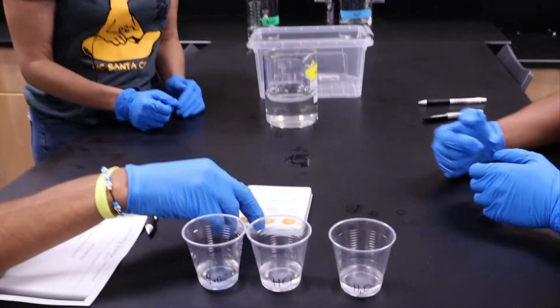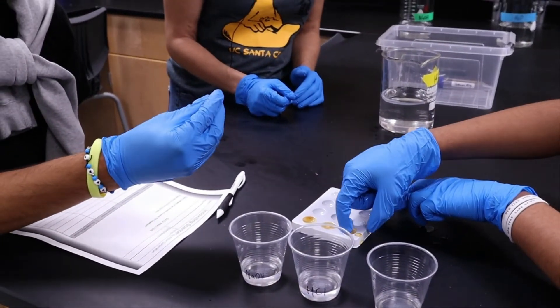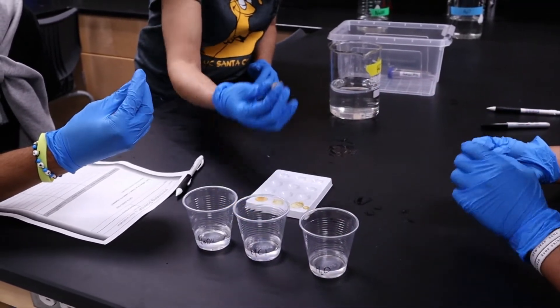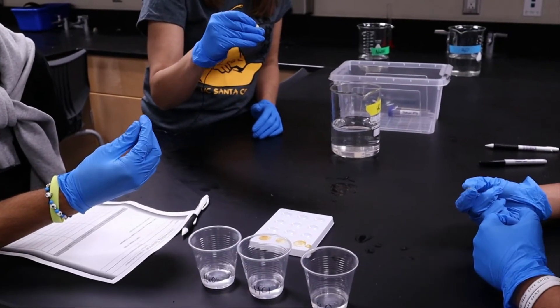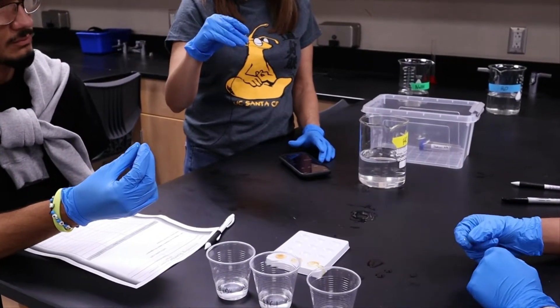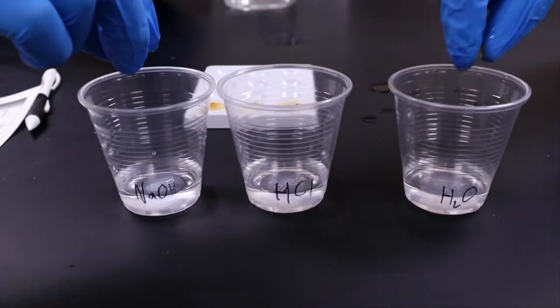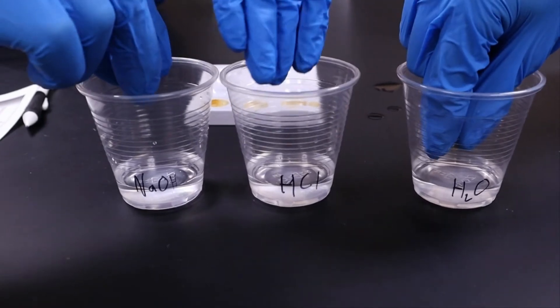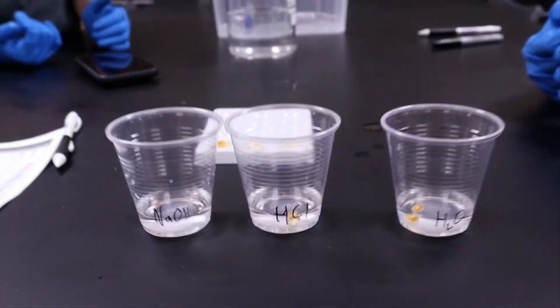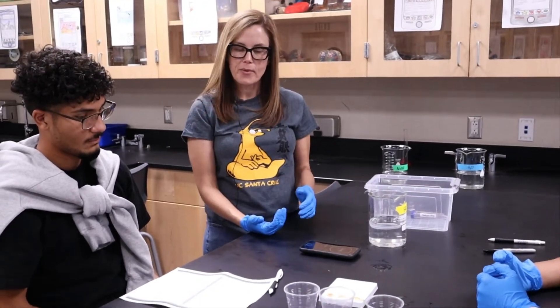Scoop out and then roll. Just roll it around in between your thumb and your finger — try to get it as coated as much as possible. I'm going to go ahead and set my timer for five minutes, and then we're going to put them in, one in each of the cups. Every 30 seconds, we're going to make observations on our data table about our results.